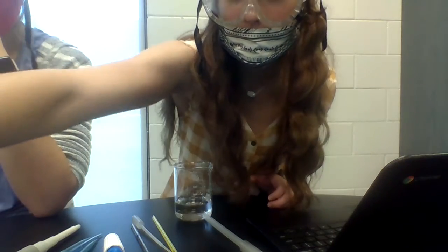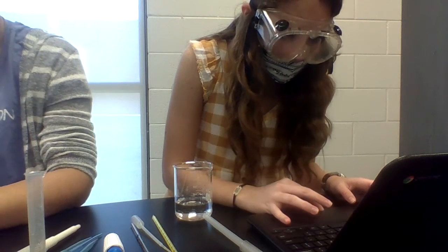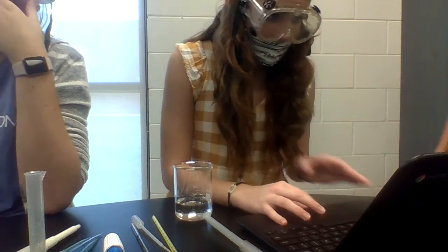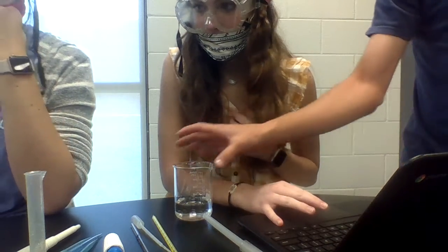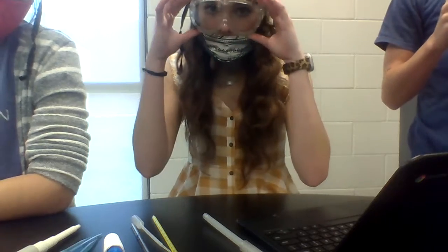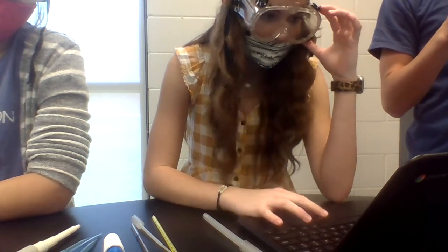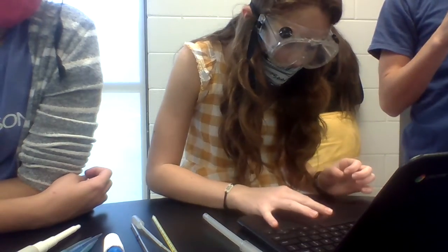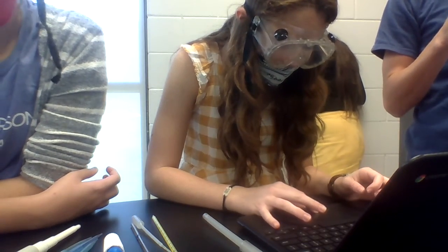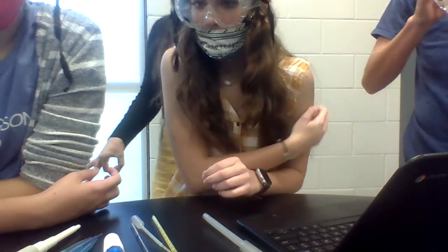Let's get some more in there. Okay, well. And it was about how much? That was supposed to be 1.00. Well, just wait a few minutes. Mine's like slow. Is yours slow? Oh, there's just a lot of space in these papers. It's like halfway. So we're gonna say 0 point... And we got 0.68.